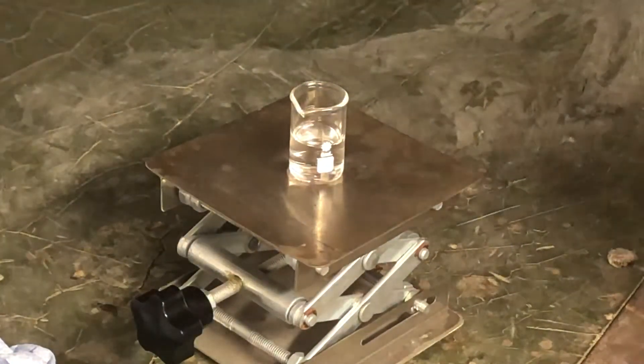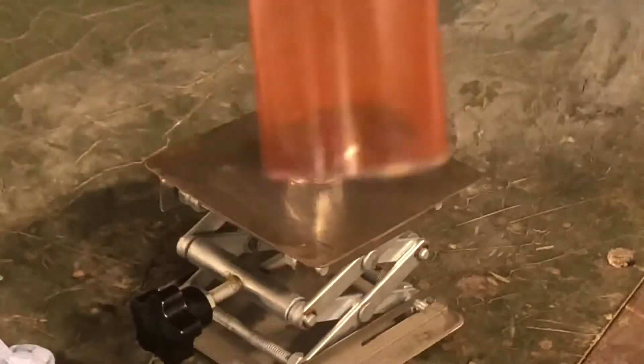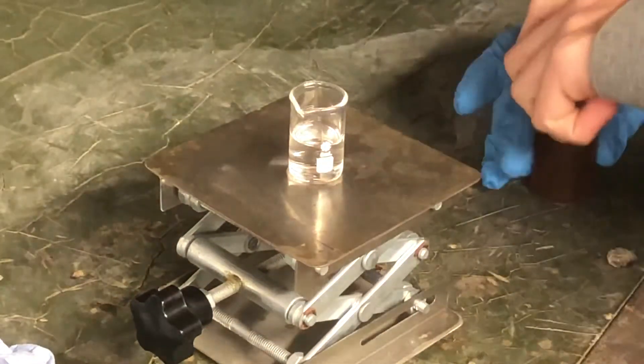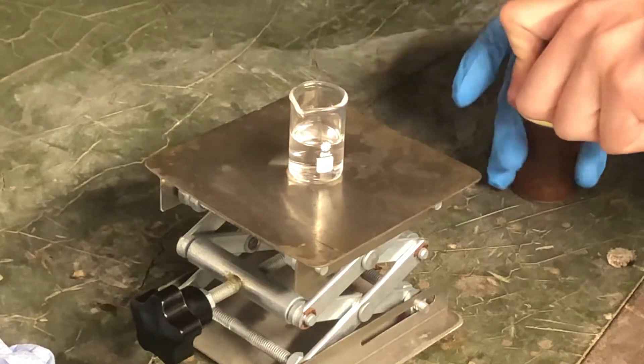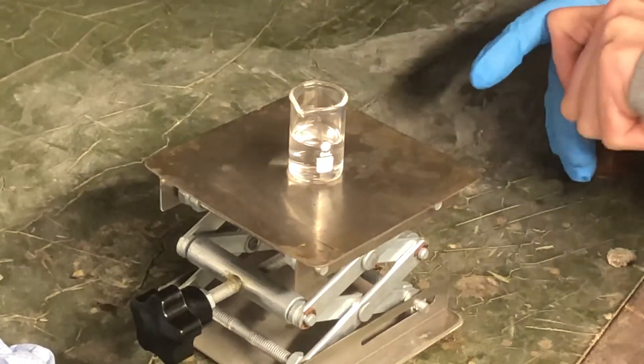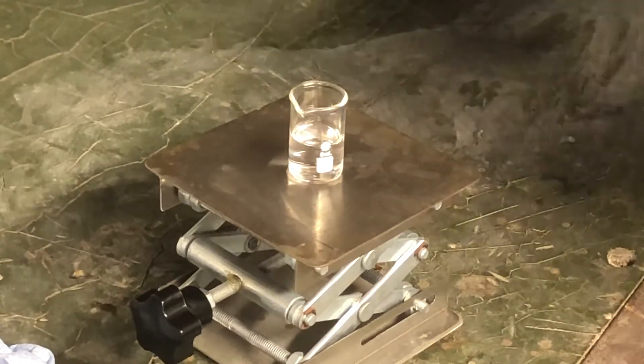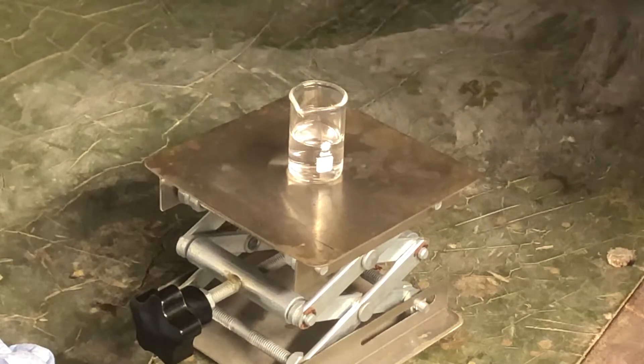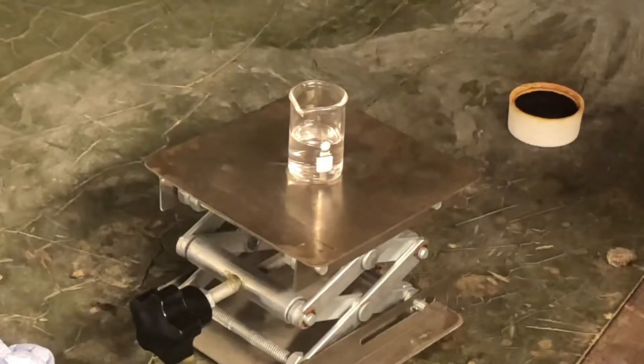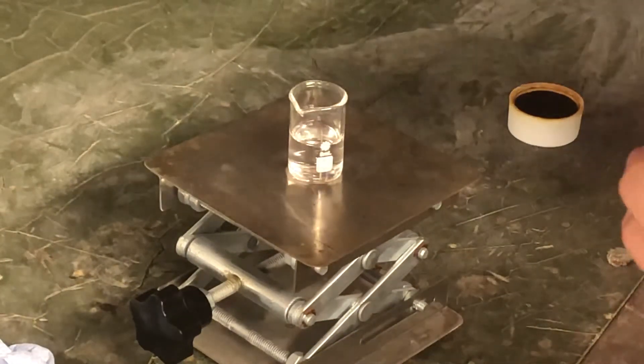You do that by adding iodine. It looks like there's a bit there, but there's actually only one gram of it. So we're going to be adding one gram of iodine to five milliliters of acetone. This actually turns out to be a massive excess of acetone because iodine is just such a heavy element.